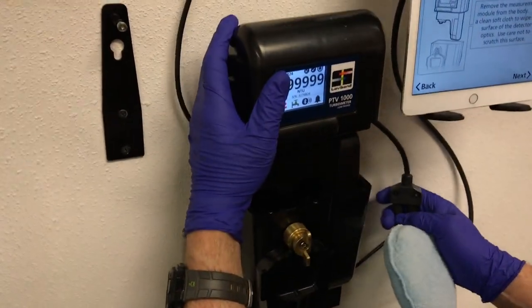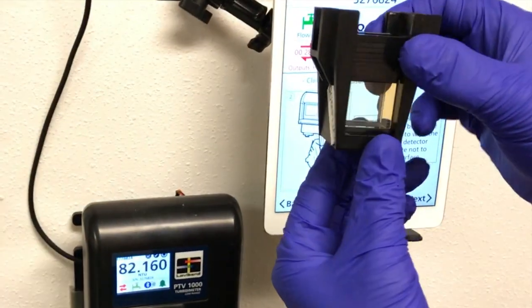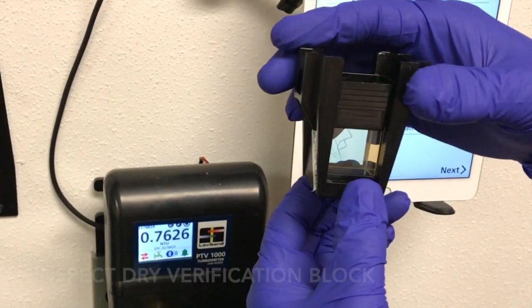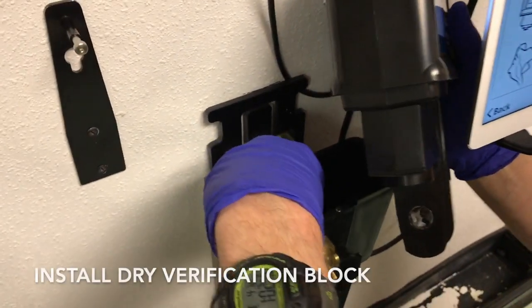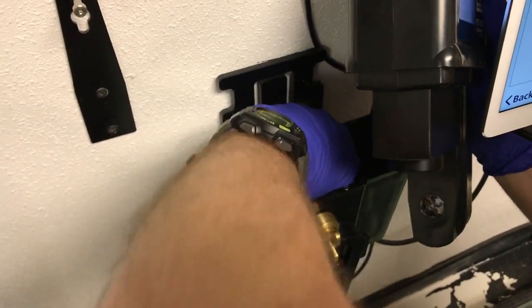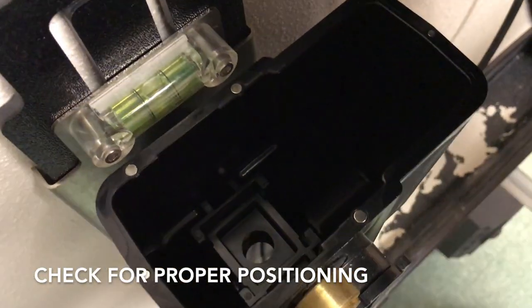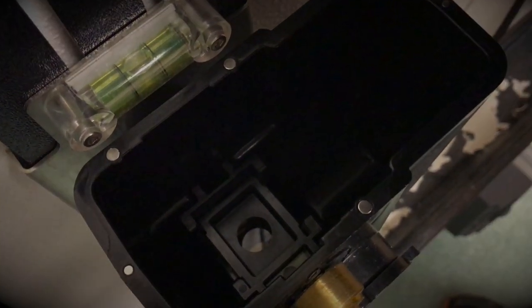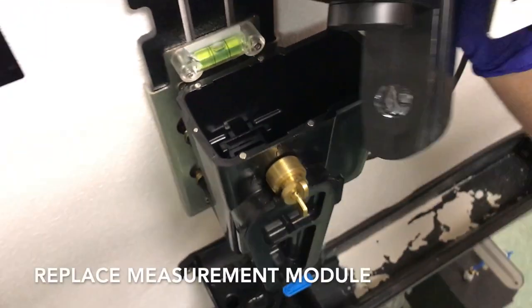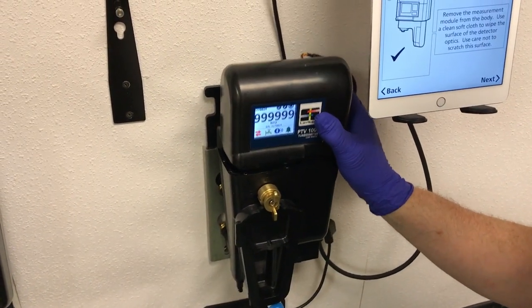Once wiped dry, the unit is now ready for a dry verification block. Inspect the dry verification block for any debris. Now install the dry verification block and check for proper positioning. Carefully replace the measurement module back over the dry verification block.